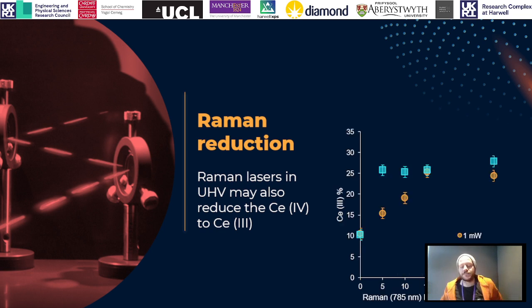And if we look at the XPS of a pre- and post-exposed sample at different Raman laser powers, we can see this effect of the power of the Raman laser on the degree of reduction of the cerium sample. So if we have a relatively higher powered laser, we get almost immediate reduction, whereas if we tune the laser power down a bit, we can slightly start to prevent this reduction from happening.